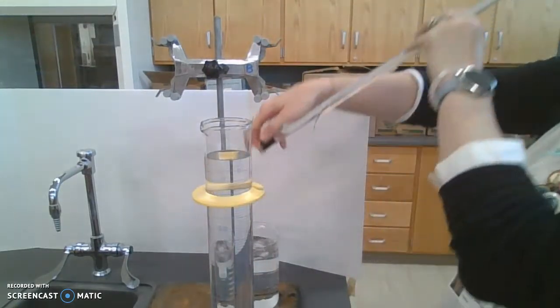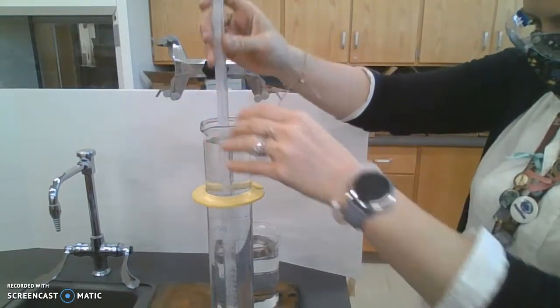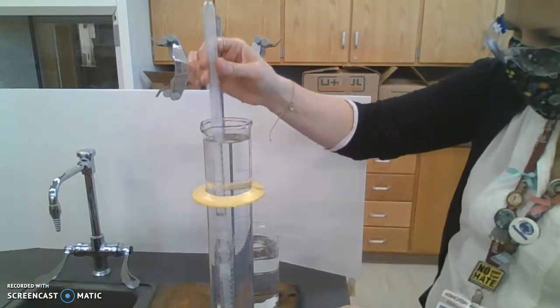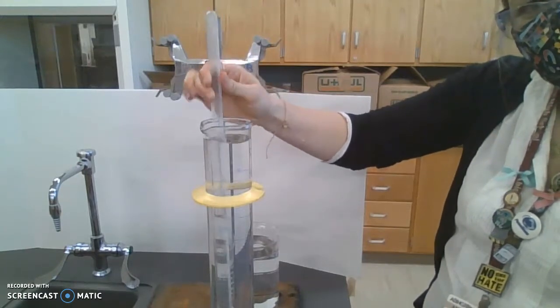Okay, so I'm going to take this, put it in here, put my finger underneath. There's also a ton of bubbles. Okay, so I'm going to gently shake those bubbles, let them go.